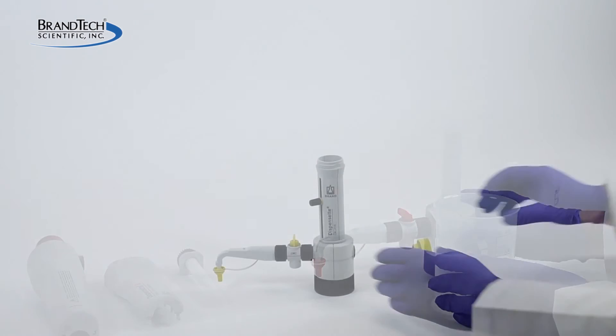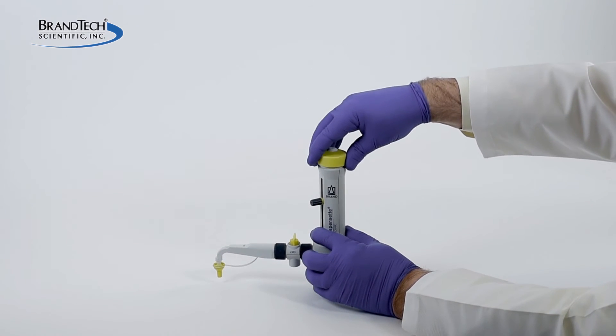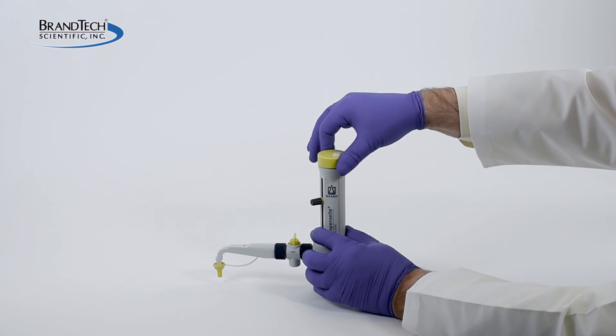And reassemble. For the analog and fixed volume models, simply place the piston back into the cylinder sleeve and tighten until secure.